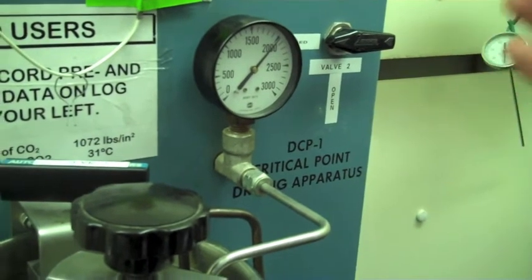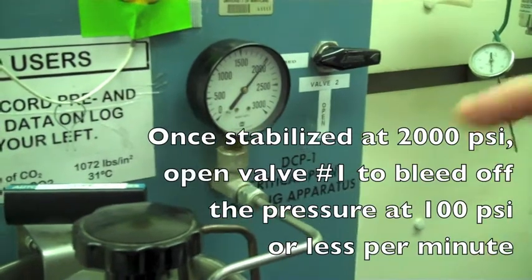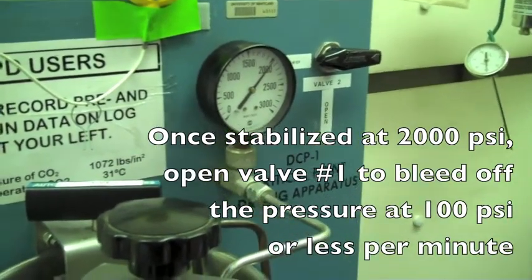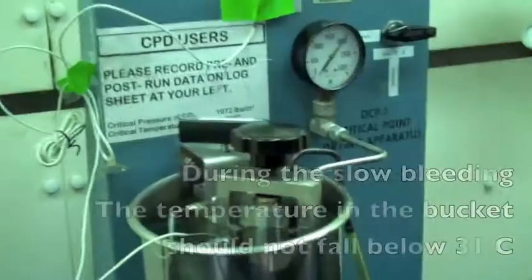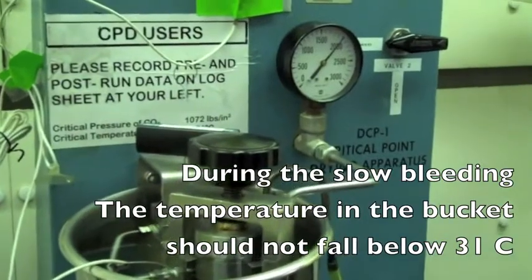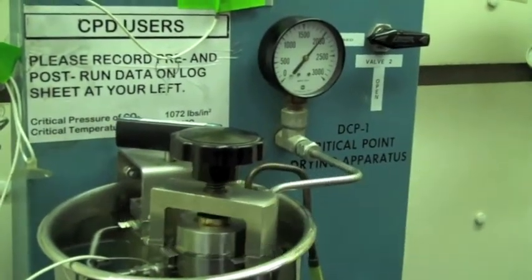And ultimately it will reach that stable point and then it will start dropping. And we want to keep that drop at a hundred pounds per square inch per minute or less. Yeah, it's still rising a little bit. But if it doesn't get past two thousand, I'll settle for that.